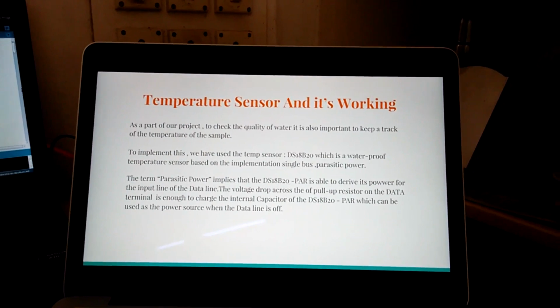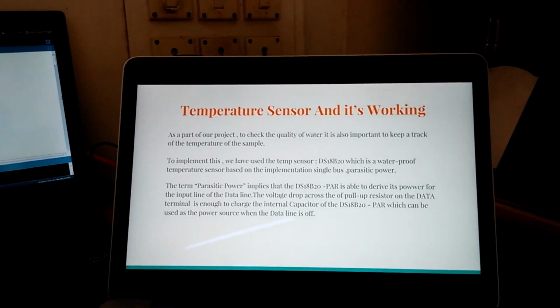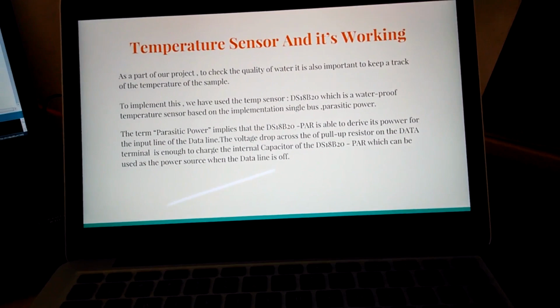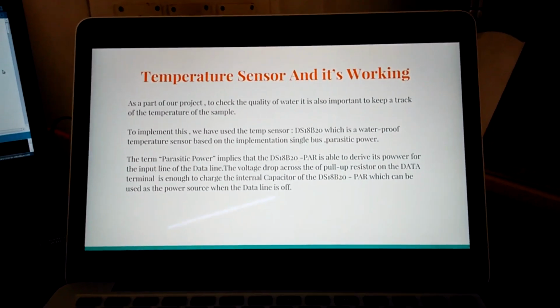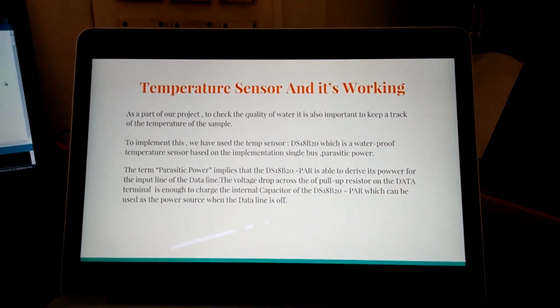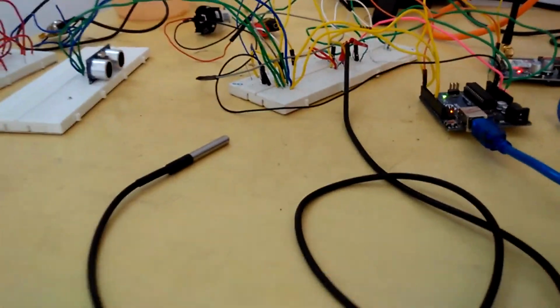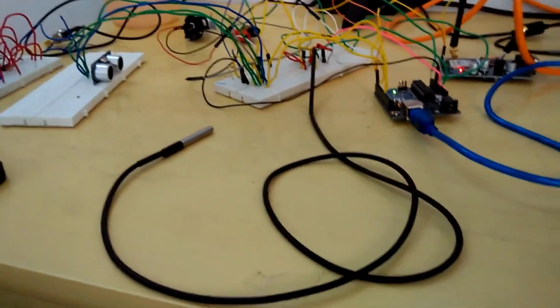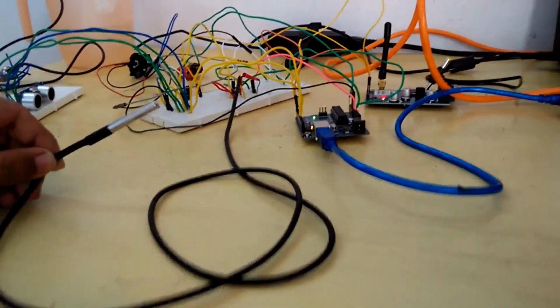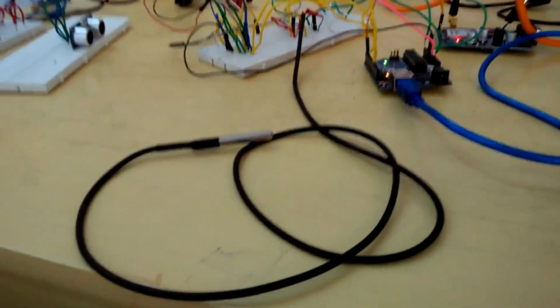Next, we have a temperature sensor. It is often important to measure the temperature of water because it's important in industrial applications where, for instance, for a particular chemical reaction to happen, say you need the water to be at a specific temperature. It is also important in pharmaceutical industries where you would not want anything to go wrong while you are making critical medicines. So we have decided to use the DS18B20 temperature probe, which is a waterproof sensor. It's elongated, in the form of a wire. So it is ideal for use in our project because the sample of water might not be close to our actual testing unit, and the waterproof part is obviously important. We don't want anything to get damaged.